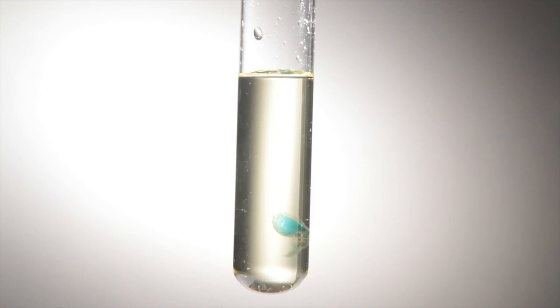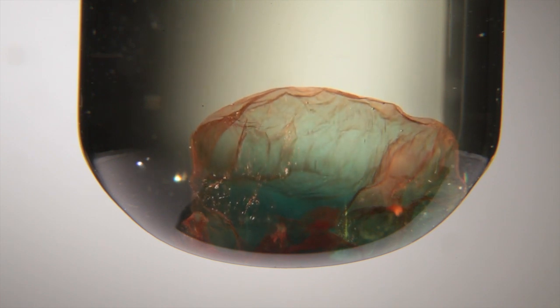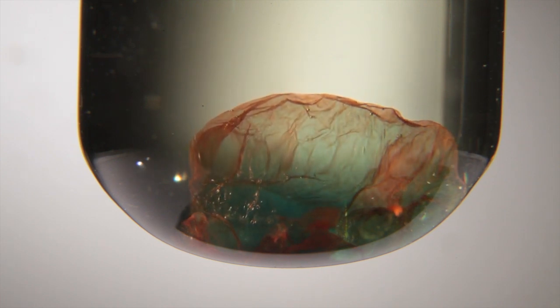All of this will happen in under a minute, assuming you've made up the solutions correctly. And over the next two to three minutes, the little cell at the base of the tube will visibly shrivel up.